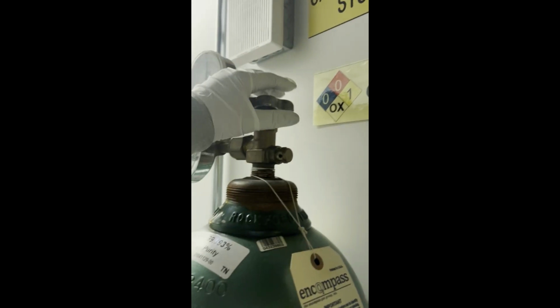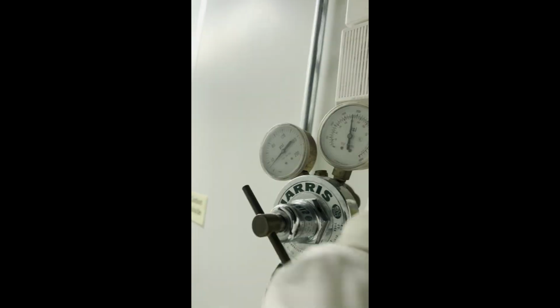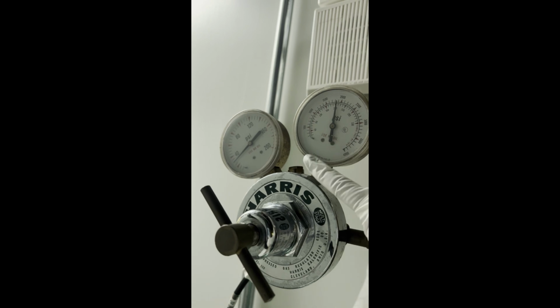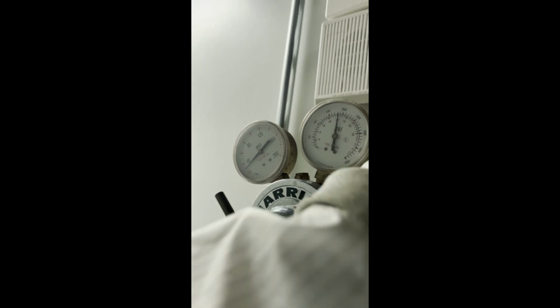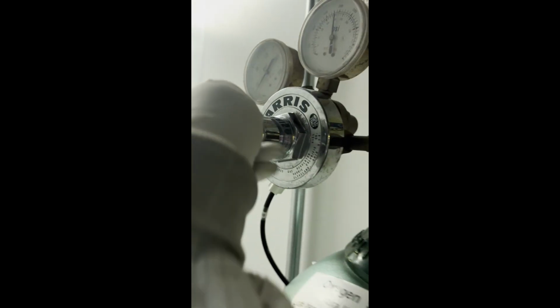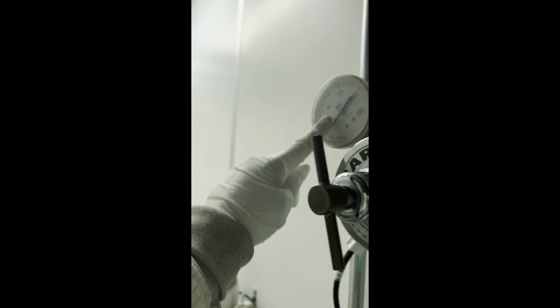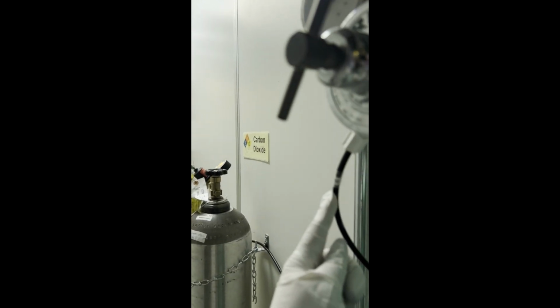You don't want to open this too much, just a couple turns left. You'll see the pressure gauges change. At 0, that means it's closed, upwards, and counting means it's open. This lever here, if you turn it right, it opens it a little bit, and this value will change according to the amount of pressure that's being put through this little tube here.